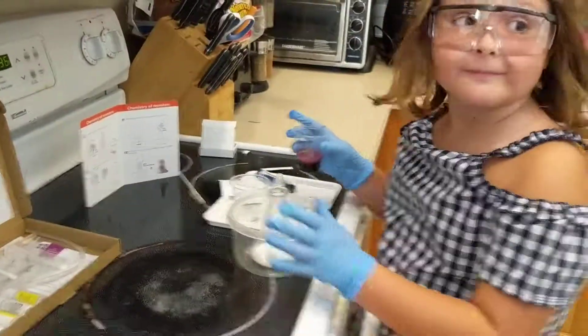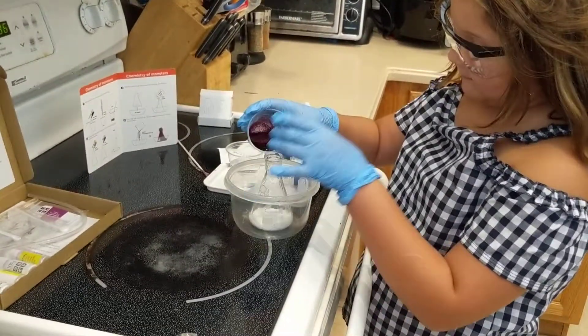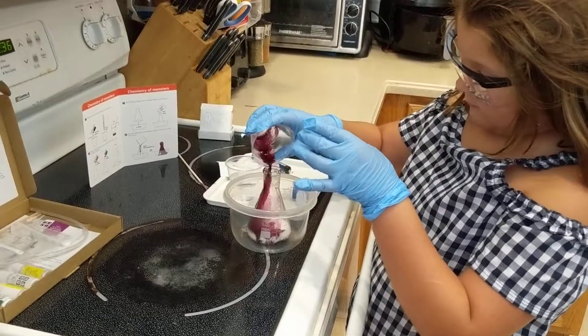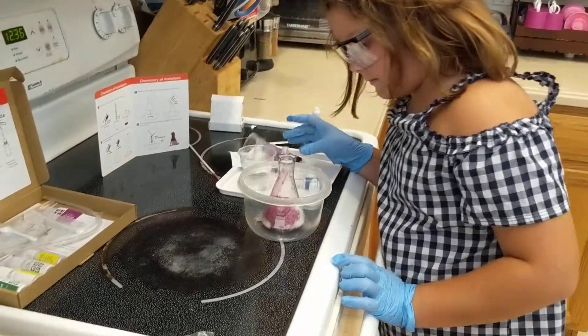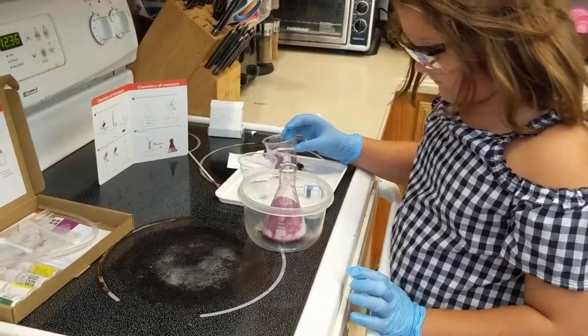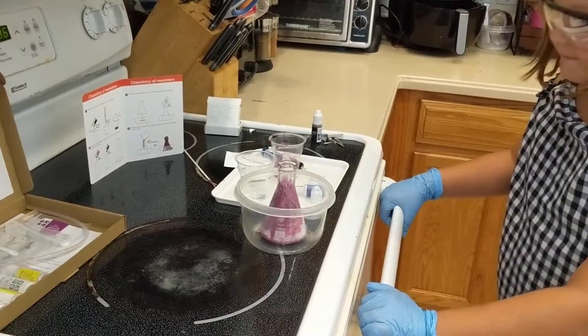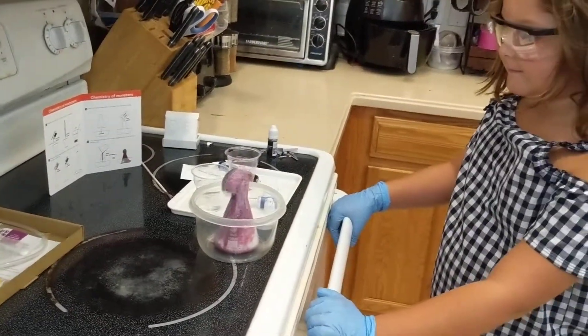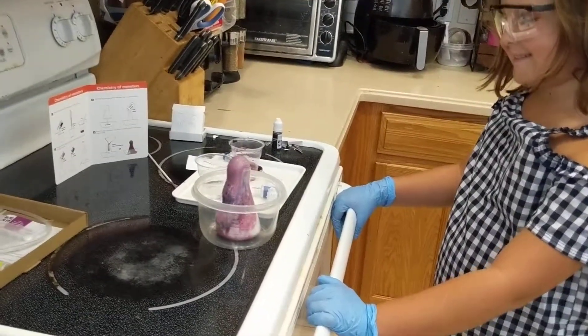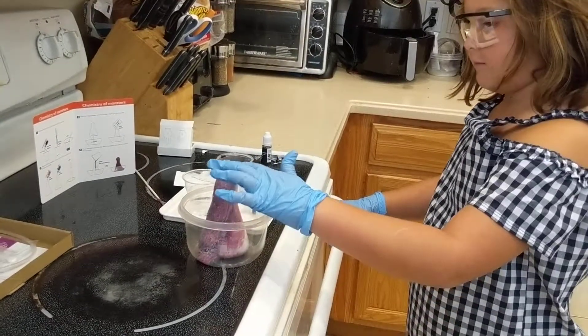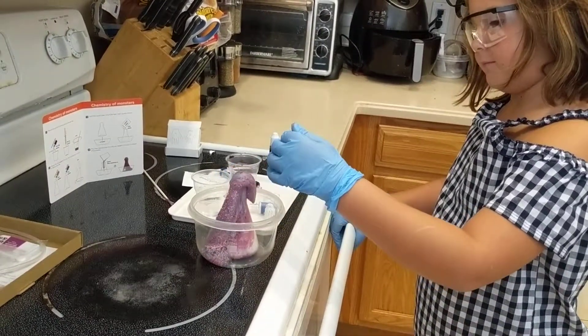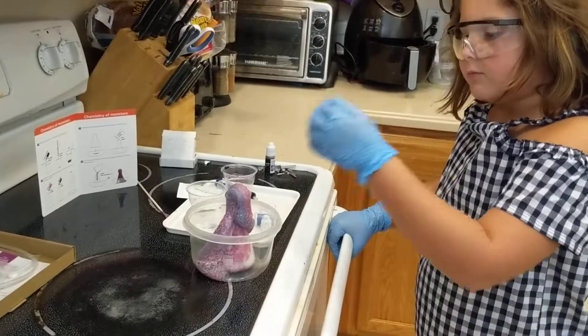You pour in your liquid. Ready? Move your hand, let's see. Oh, there it goes. Is it okay to touch it? With your gloves on, yeah. That's really cool.